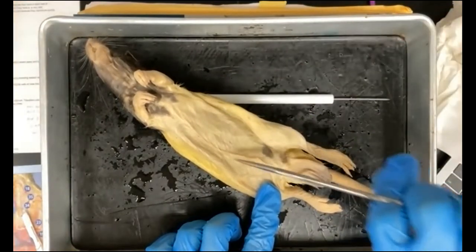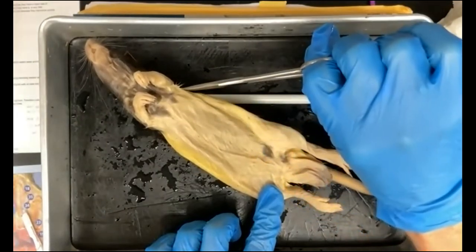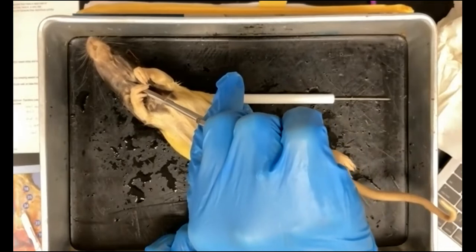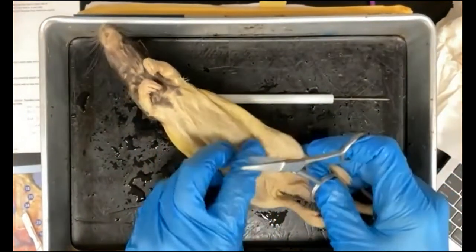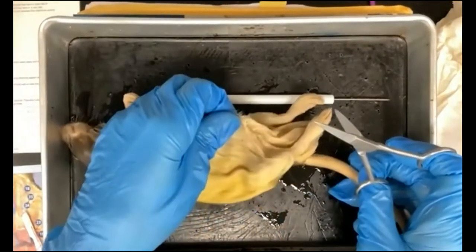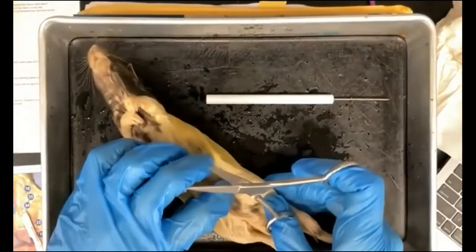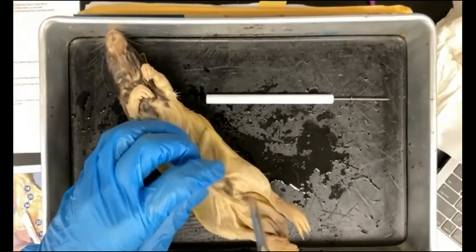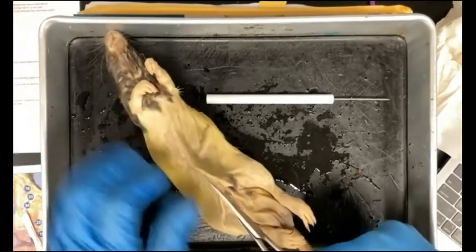So this is going to be incision 1, incision 2, incision 3, like you see up on the board. Incision 4 will go all the way up to the base of the neck, and incision 5 will go across from ear to ear. So the most important thing is that you lift up the skin. As you can see here, I'm lifting up the skin so that you don't puncture internal organs. And I'm just going to make a snip here so that I can actually enter into the abdominal cavity.